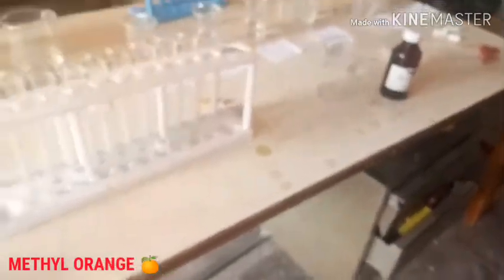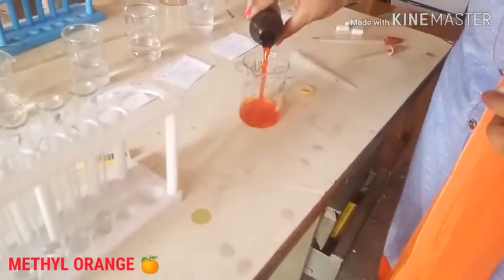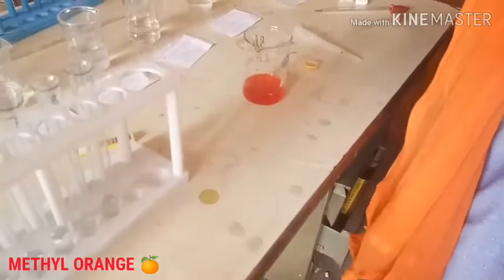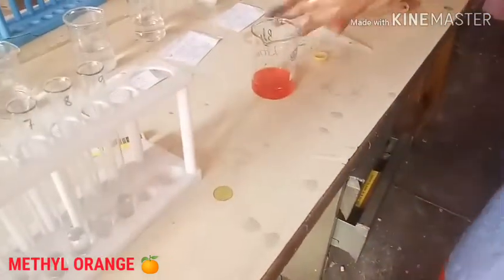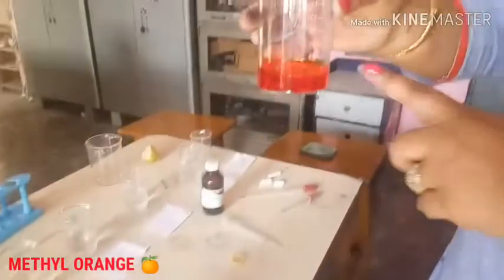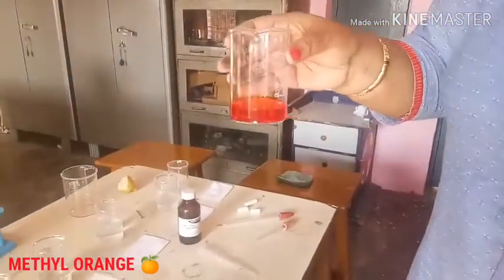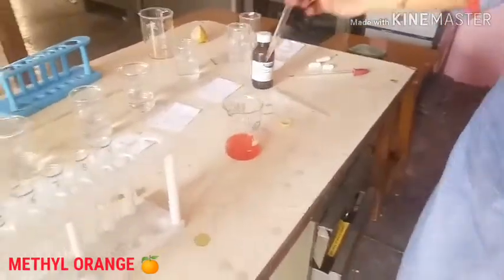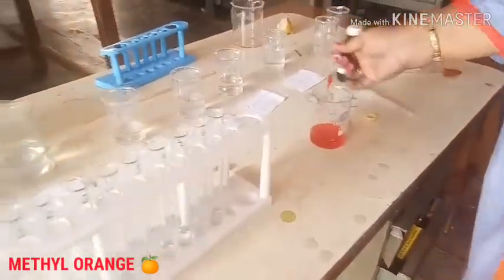I put this Methyl Orange in a beaker. It has a very nice color. As you can see, it is orange — bright orange. Now let's see how it reacts with acid and base.